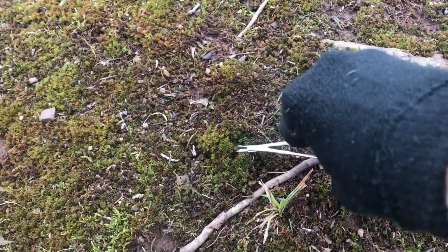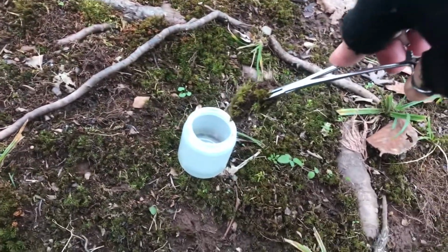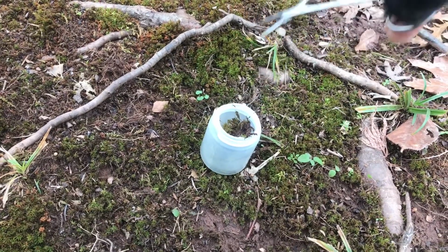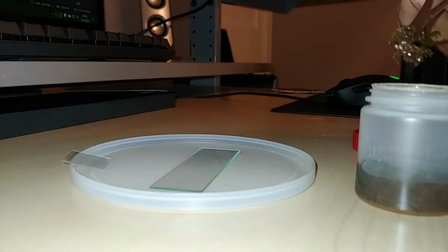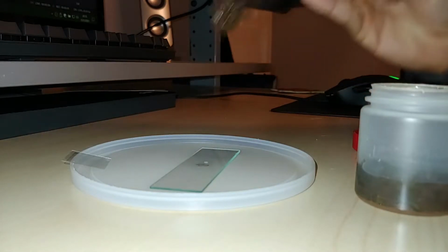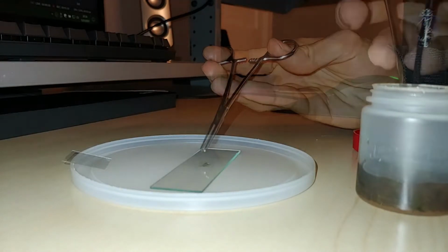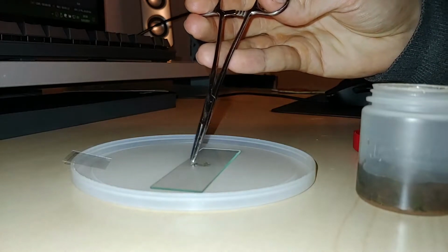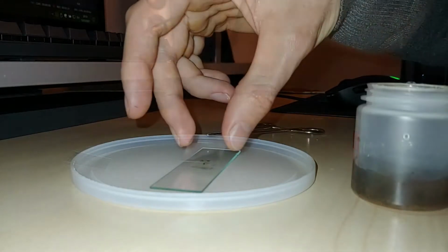Even though it's the dead of winter and it's been rather dry for a while now, I think that moss sample still has secrets to reveal to us. So I dabbed some water off of the moss itself and put a few more of the moss leaves onto a slide so we can see if maybe there are some microbes hanging out in there.